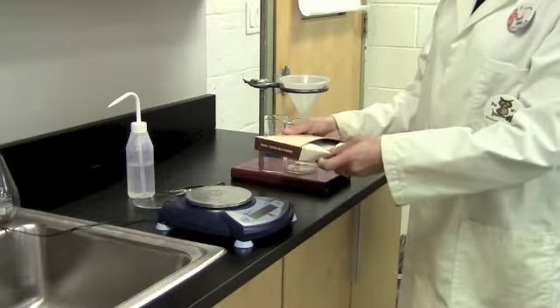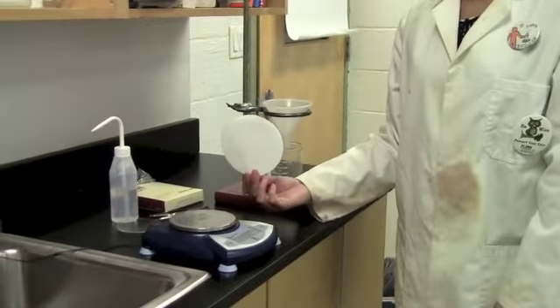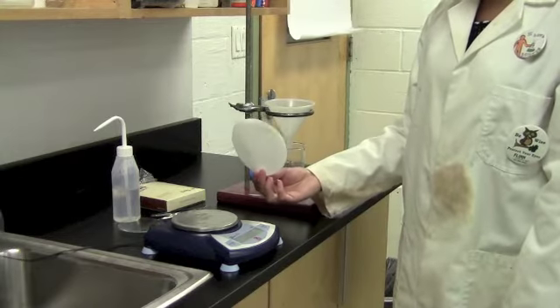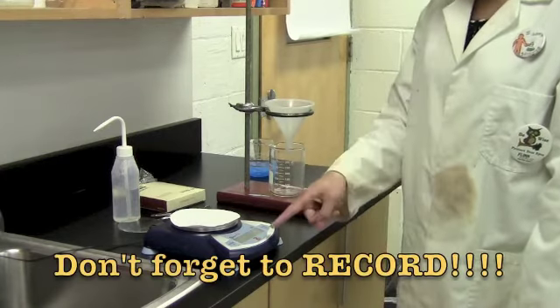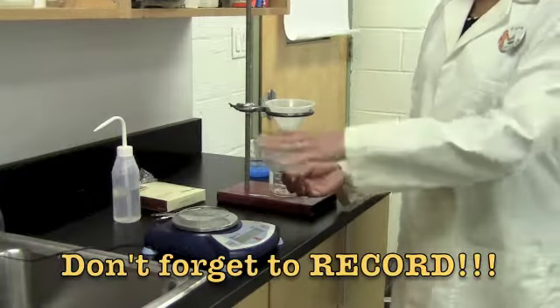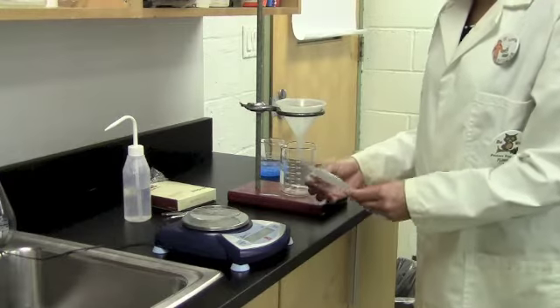Now you're going to want to put a piece of filter paper into your funnel to catch the solid. You're going to need to know the mass of the filter paper before you put it in, so that when we're done we can subtract the mass of the filter paper from the filter paper and the solid, so we know just the mass of the solid. So we're going to place the filter paper on the balance and record the mass. I'm also going to weigh a watch glass and record its mass. This is what we're going to put the filter paper and the solid on after the filtration. Again, this will allow us to just subtract the mass of the watch glass after the experiment.